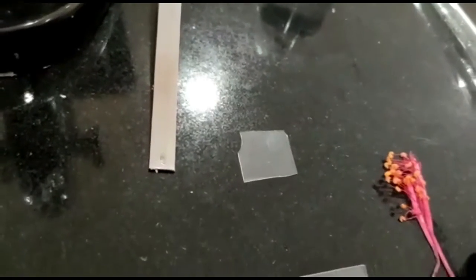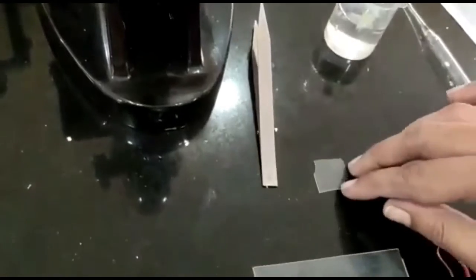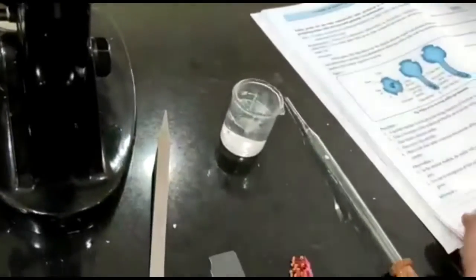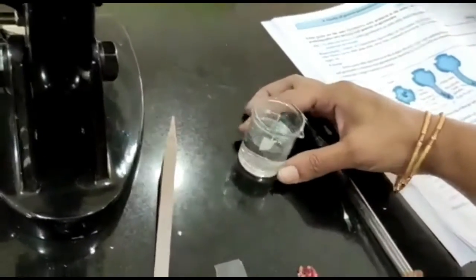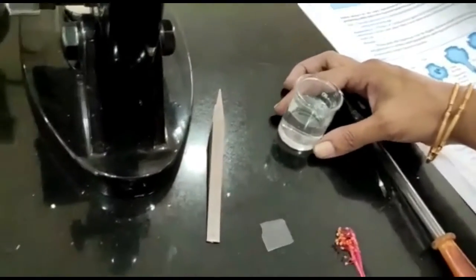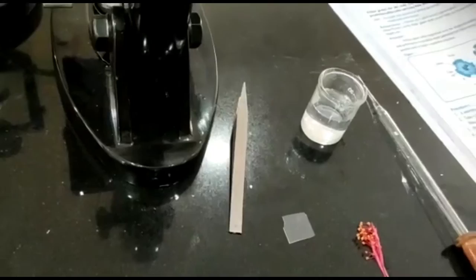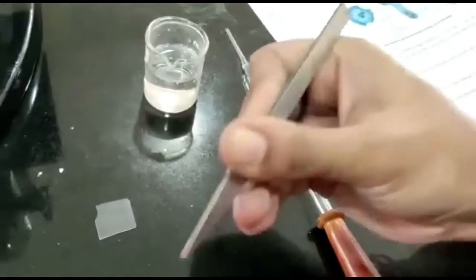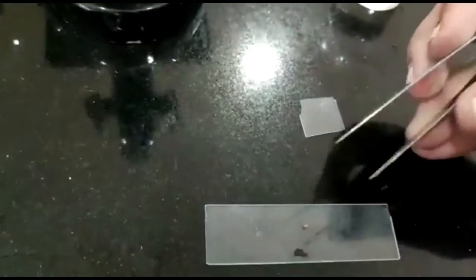The aim of the experiment is to study the pollen germination on a slide. Requirements for the same are fresh seasonal flowers — we can use any flower; here we are using the hibiscus flower. We only have to use the pollen grains, slide, cover slip, microscope, sucrose, boric acid, magnesium sulfate, potassium nitrate, beakers, etc.